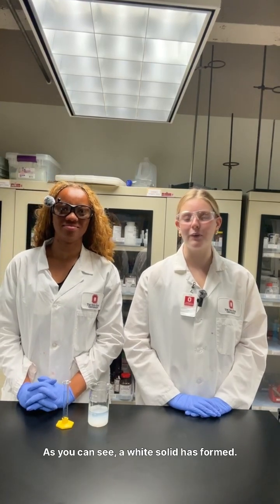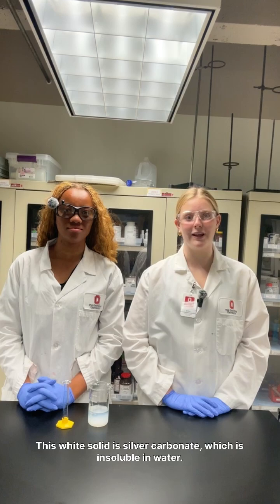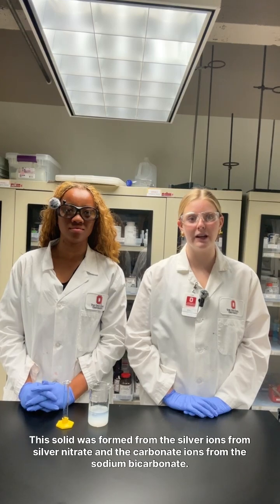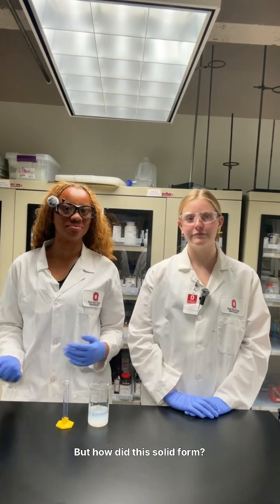As you can see, a white solid has formed. This white solid is silver carbonate, which is insoluble in water. This solid was formed from the silver ions from silver nitrate and the carbonate ions from the sodium bicarbonate. But how did this solid form?